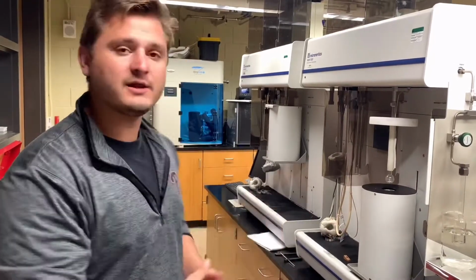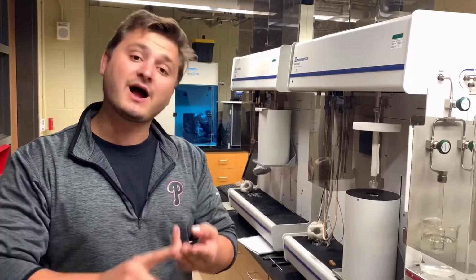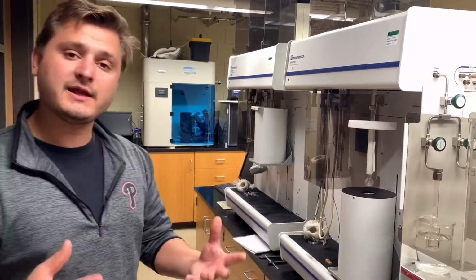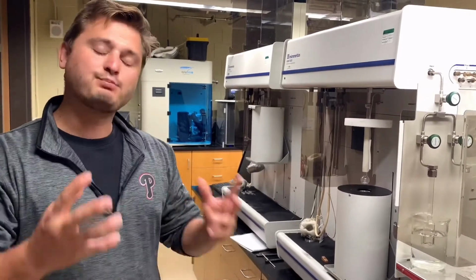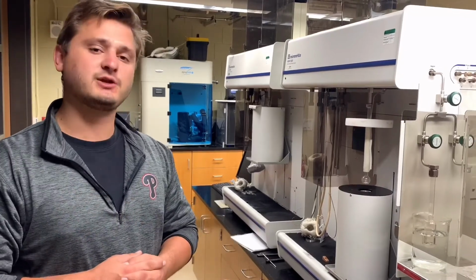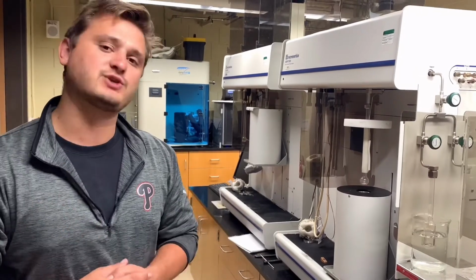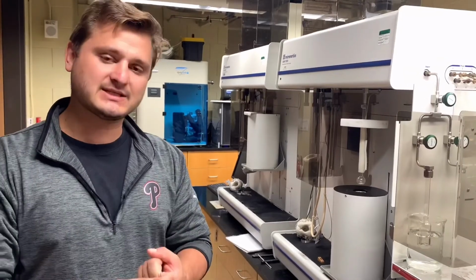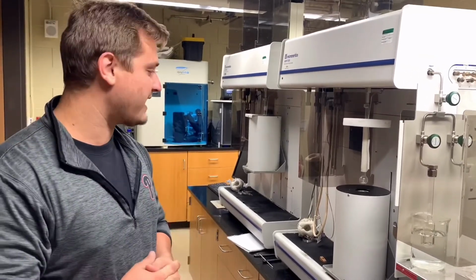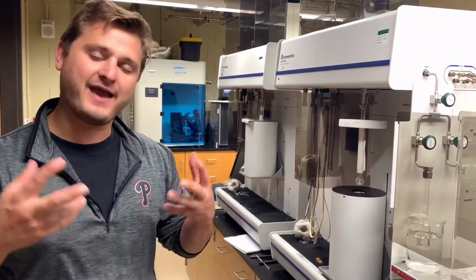Overall, these are really, really amazing instruments. We get a lot of really amazing data from these instruments about the pore sizes, the surface areas, the porosities, and the ability of our different materials to adsorb a large variety of analytes. There are a lot of things that can be done, and please consult some of the other videos that potentially will be made, or Micromeritics or our senior students on how to do those other functions. But what was shown today is how to run the basics of the instrument, how to degas the sample, and how to run an analysis of the sample in order to get the porosity and BET surface area of any sort of sample that you are running.